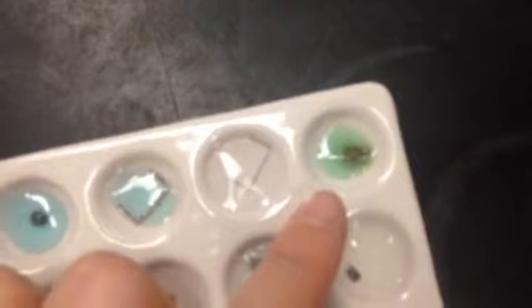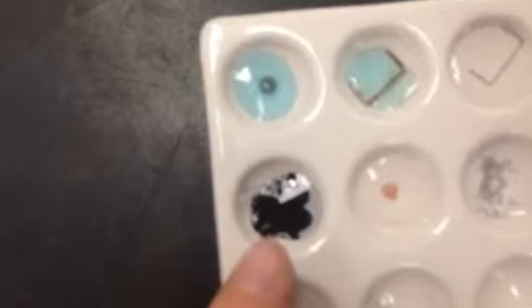In this one, so this is the magnesium and copper 2 chloride. Notice that the solution's actually starting to turn from blue to yellow. Actually saw a couple bubbles just get released. And then the silver surface of the metal is actually getting, again, kind of that coppery color on it. This well over here is the zinc and the copper 2 chloride. So that definitely has changed from the silvery color and the bluish solution color to like a blackish color.